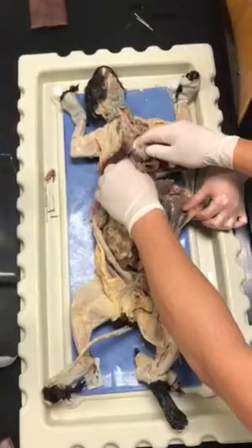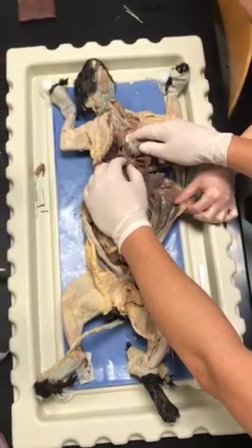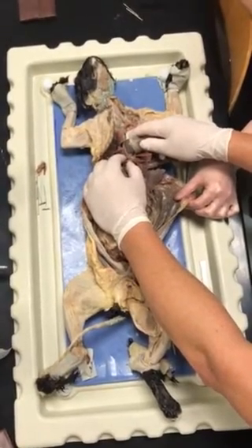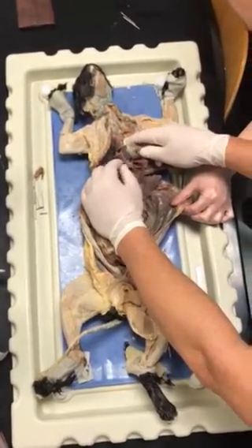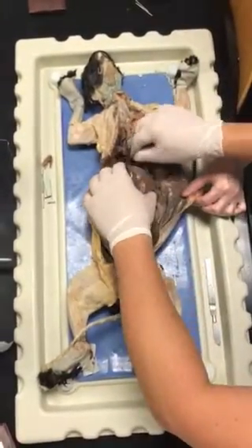Cats have more lobes than you do. They have more lobes. Yep, they're all separate. They're like 7 separate lungs, really. Okay, so they're called lobes, but they're really like 7 mini lungs, basically. And they all have their own primary bronchi coming off into it.